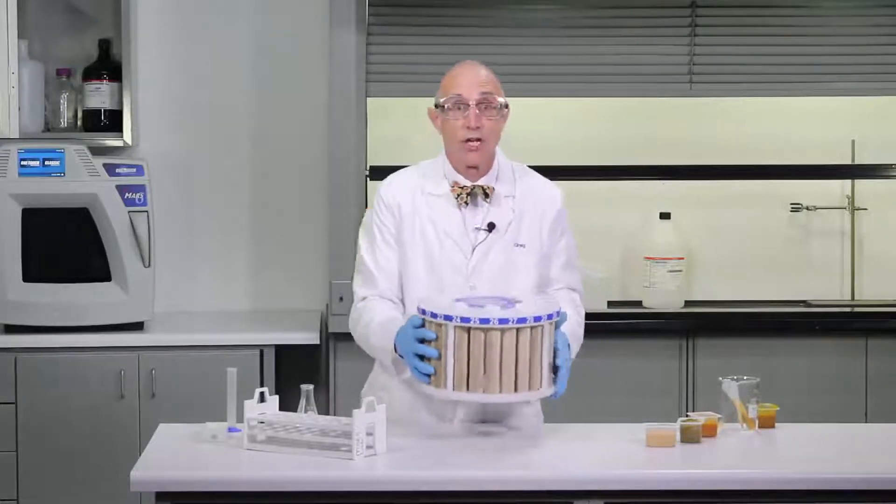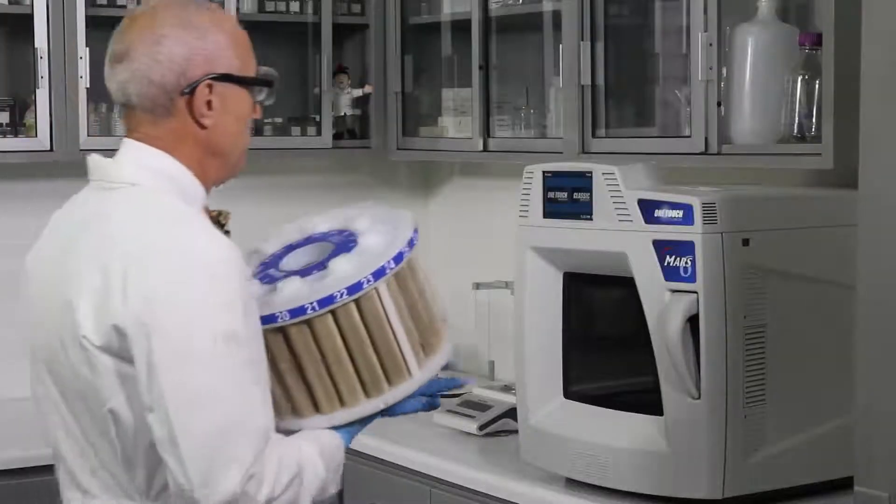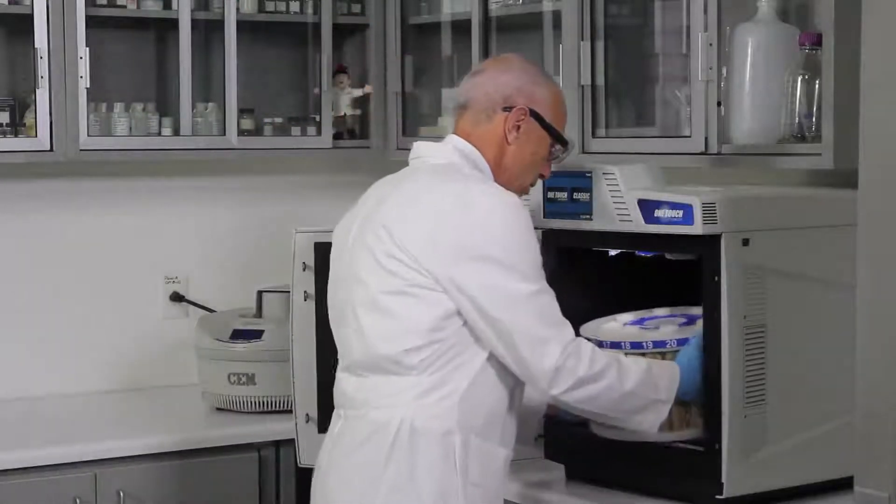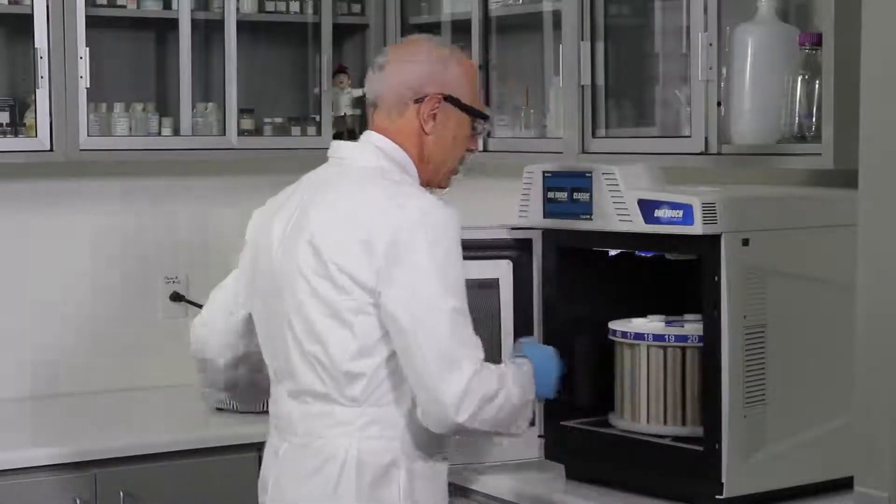Got them all into the turntable. Bring our samples over to the microwave system, open the door, turntable of samples inside the cavity.